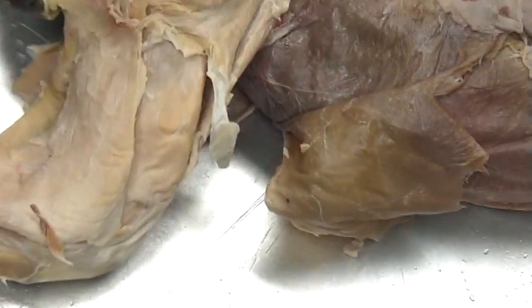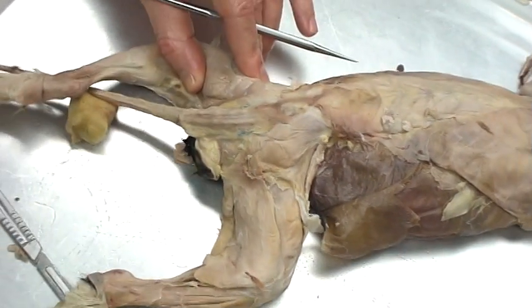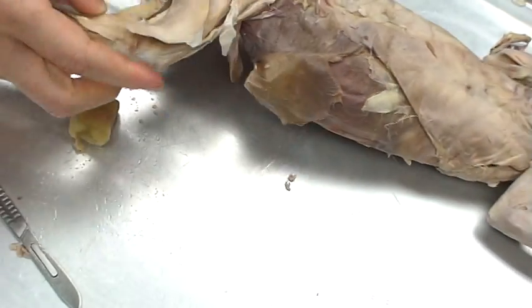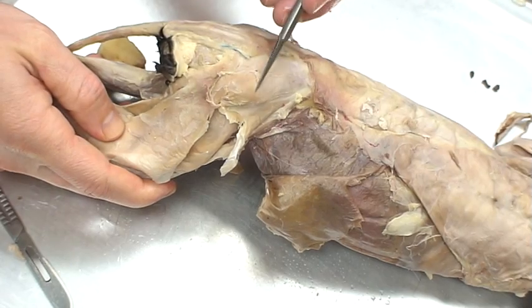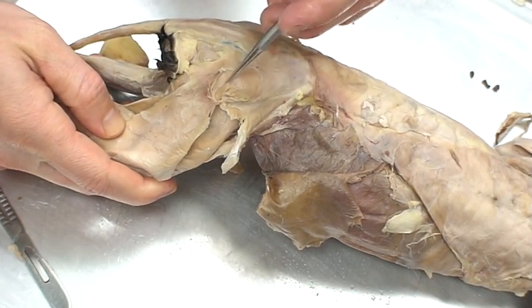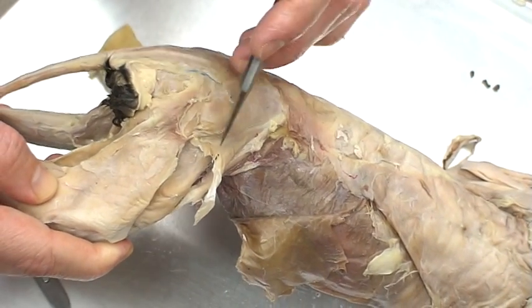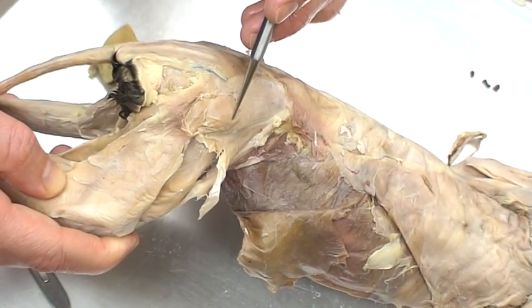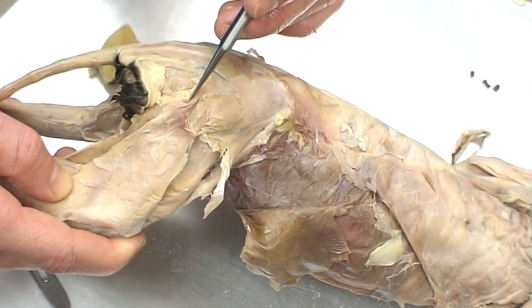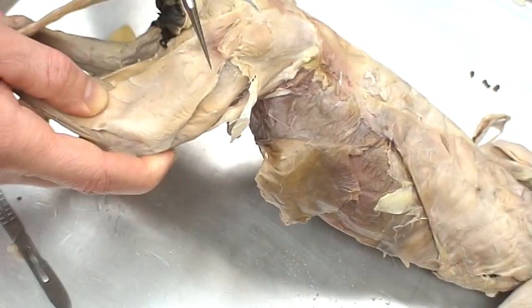Now when we take a look at the leg muscles, we'll start from the lateral aspect — we'll see from the outside. What we're going to see are some gluteal muscles. They're pretty tough to define and capture on camera. We've got the gluteus medius or gluteus minimus — you'll see both terms used; this is the smaller one but it's actually bigger on the cat. Here's the gluteus maximus from here to here. Now as we work our way down, here's the biceps femoris.